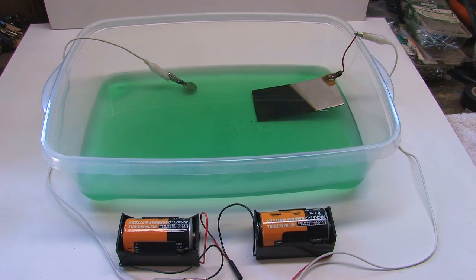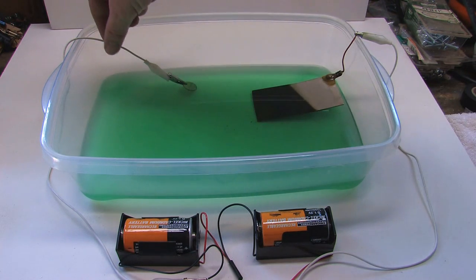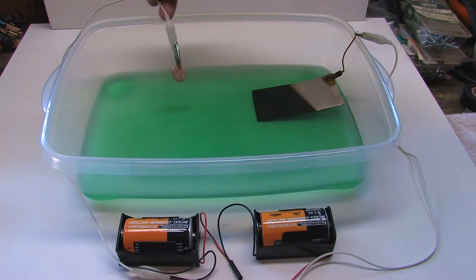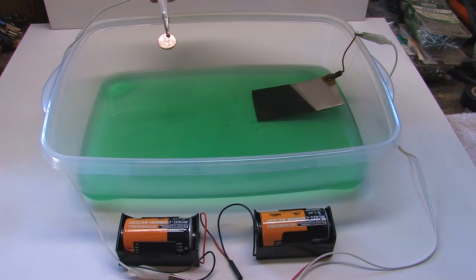I've had long, long, long-term bad results any time I used anything other than a very small amount of electricity for this. And check this out, this was only a couple of seconds and look at that. We've already got a nickel plate starting.